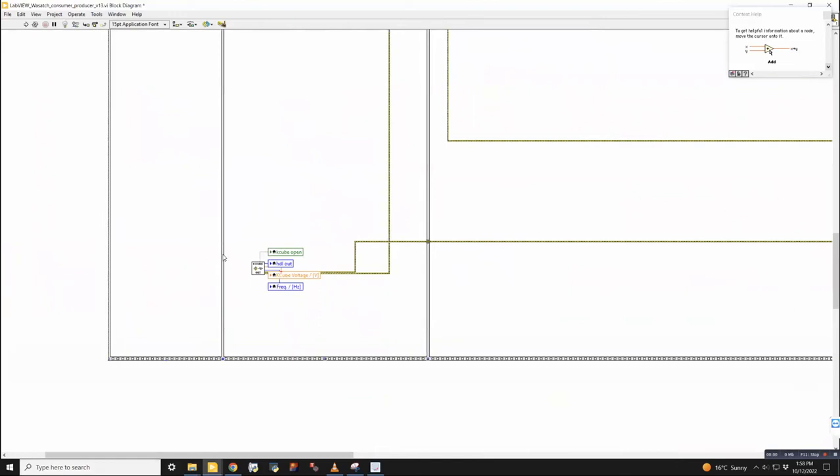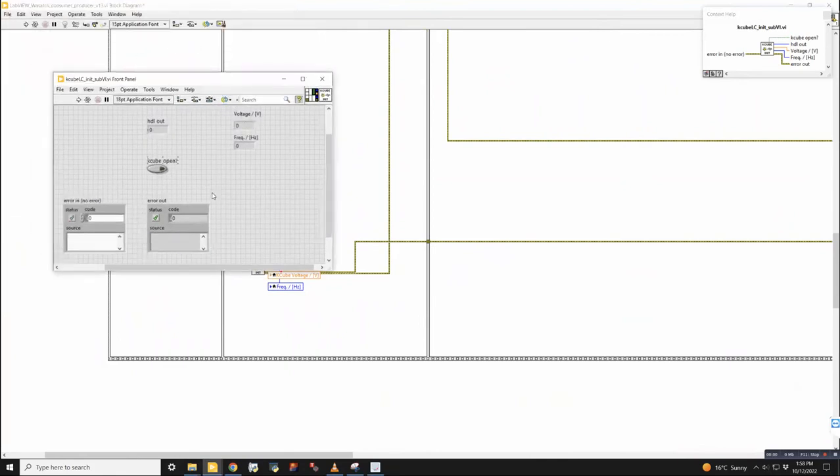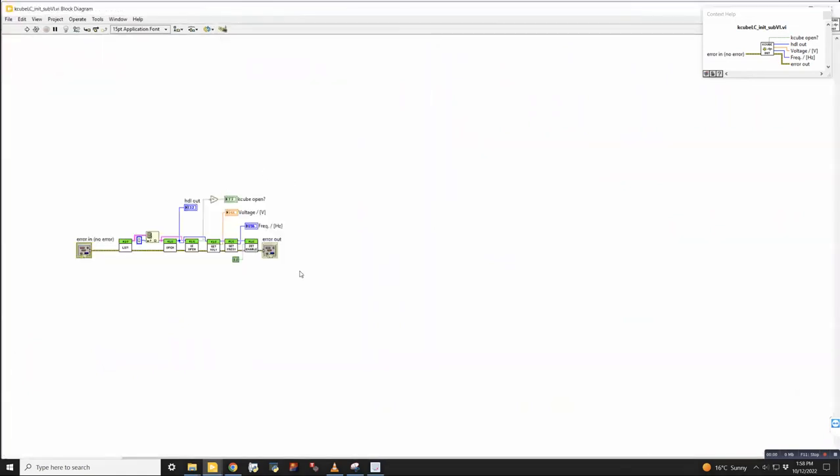Okay. So the way that this works is we have an initialization for the K-Cube. And this is a sub VI. So if you double click it, it'll bring up the sub VI, and then I can go into its back panel and it shows this. So these are pieces of software that are written by Thorlabs to control the instruments. So what we've done here is kind of piece all of those different small subroutines that they've written into one program that initializes all the settings that we're interested in.